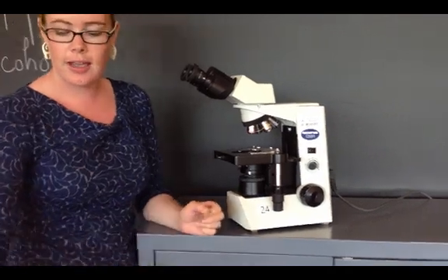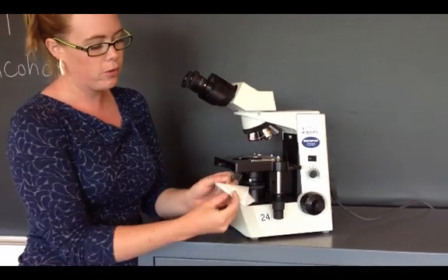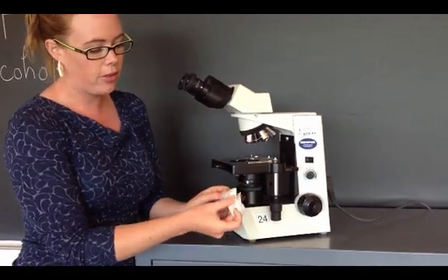Then you can take a clean piece of dry lens paper and remove any traces of the ethyl alcohol.